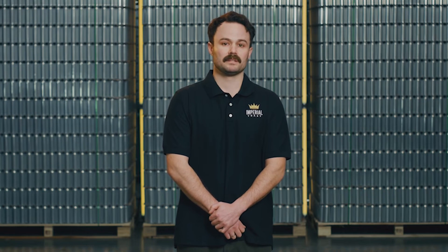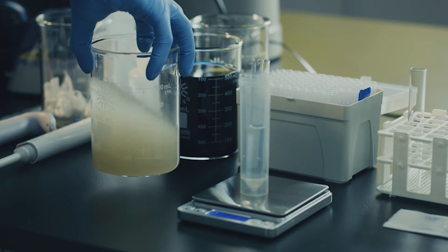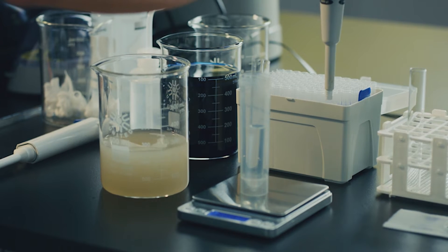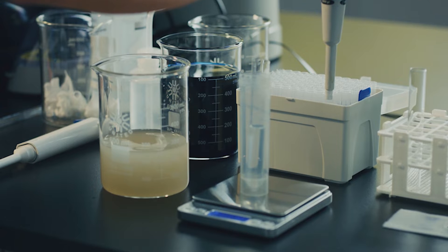Next you will have to dilute the yeast prior to counting. A typical dilution is anywhere from 200 to 1,000 times. These dilutions can be done by weight with a scale or by volume with pipettes, and most of the time it will be a combination of both. It is important to make these dilutions as accurate as possible, as any significant variation will create errors in the final pitch rate of yeast in your fermentation.